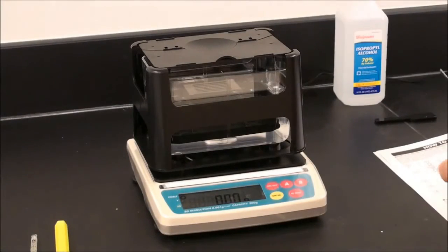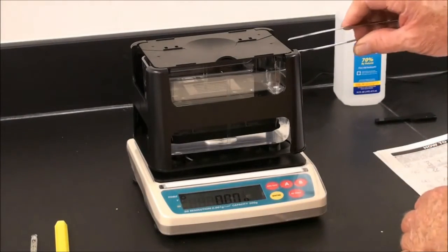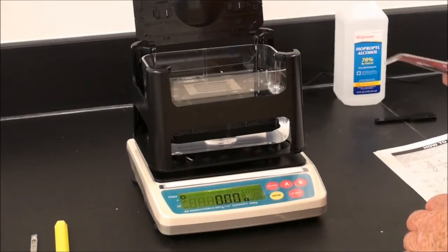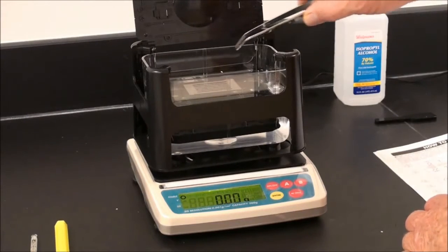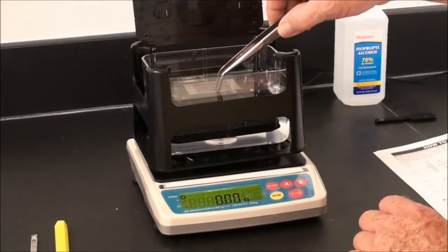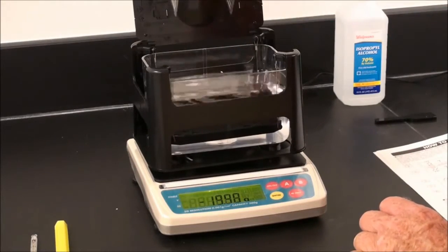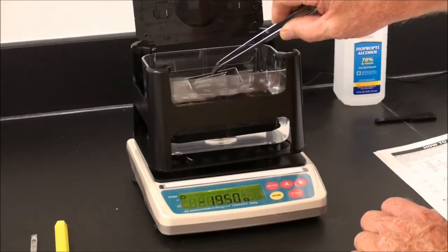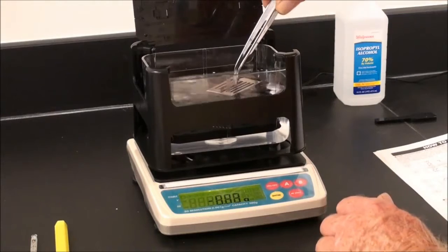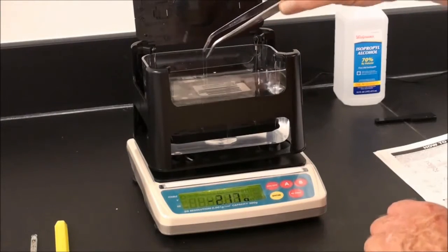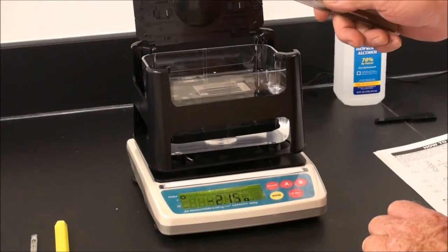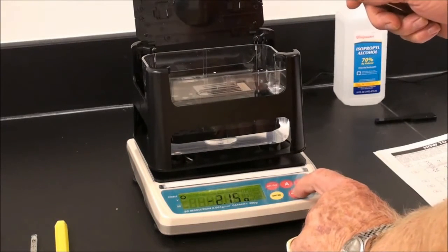For proper setup, position the weighing stage in the tank of water. Fill with water to the indicator mark. Place the sensor stage directly into the water using tweezers. See that the sensor stage does not touch the side of the tank in any way, and press zero.